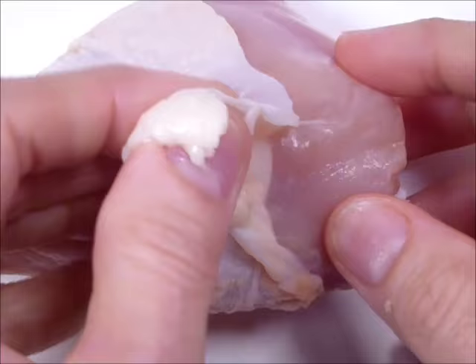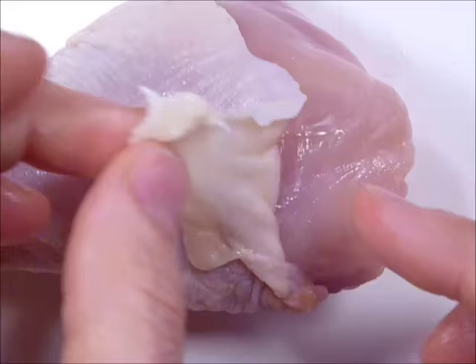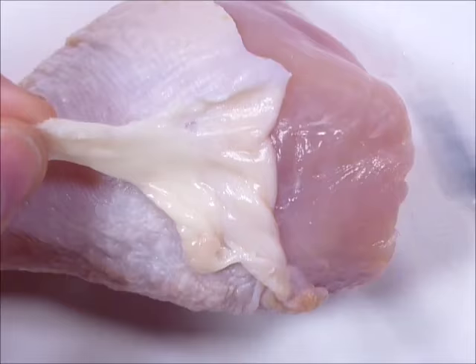Let's peel back a little bit. The adipose tissue is connected here so you can see where it ends. This still looks kind of yellow — I'd call this the adipose. But right here, what we have is the bottom layer of the skin.